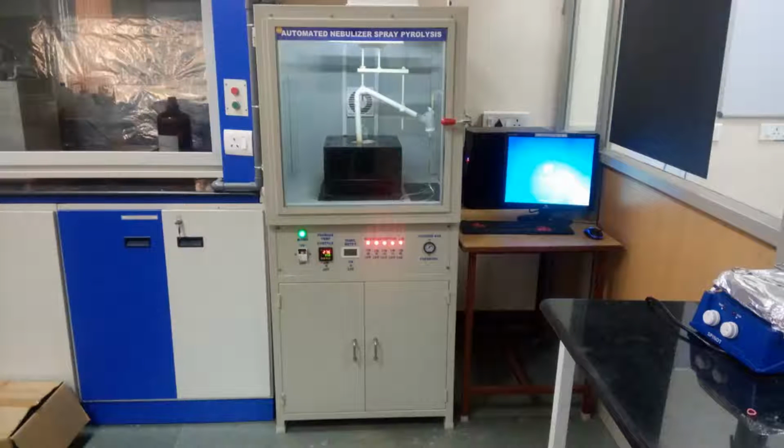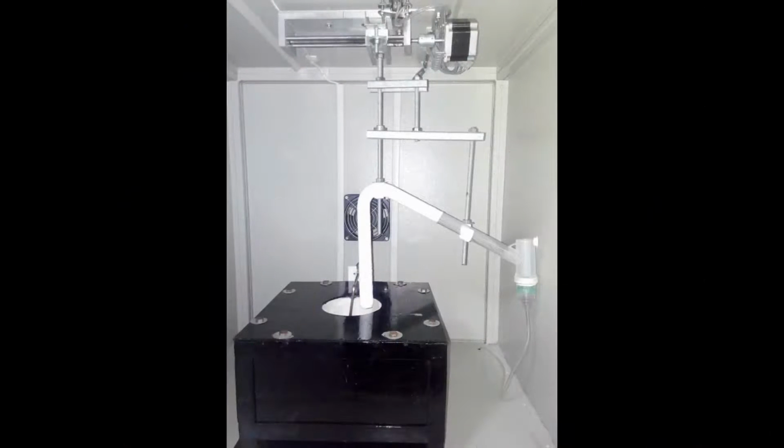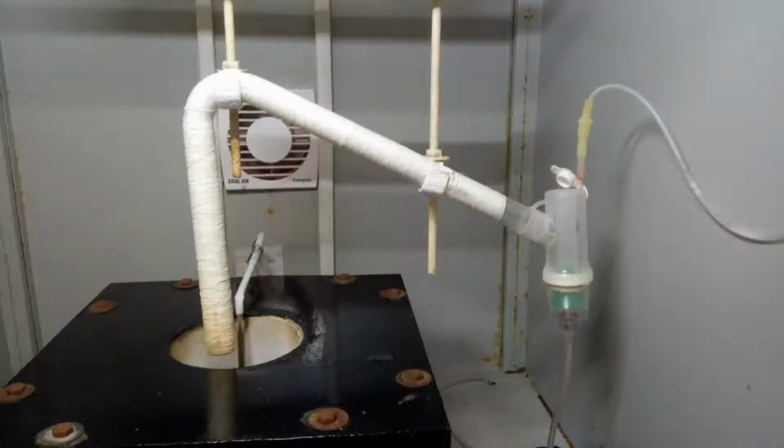This is the real photograph of the complete deposition unit developed and installed in the Multifunctional Materials and Devices Lab of Shastra University. This is the inside view of the fume hood. As seen in the photograph, the substrate to guiding tube exit distance can be varied by changing the fasteners' position on the threaded rods. This is a close view of the nebulizer with its guiding tube.